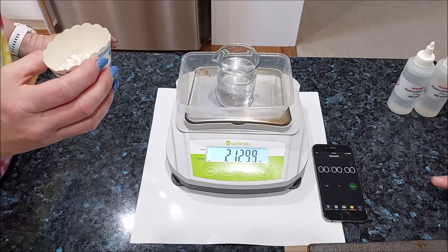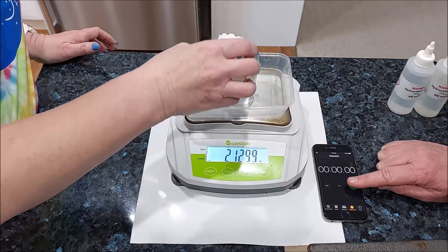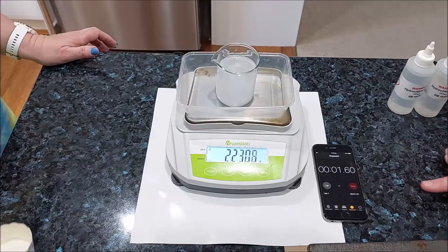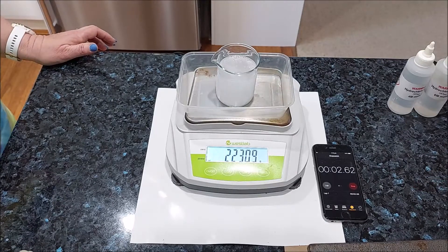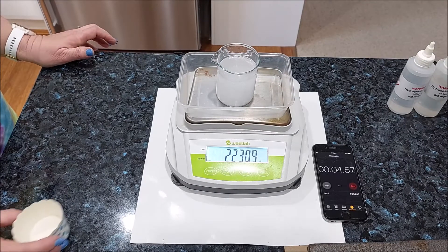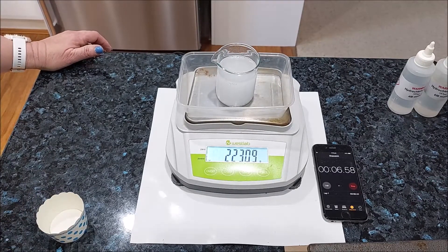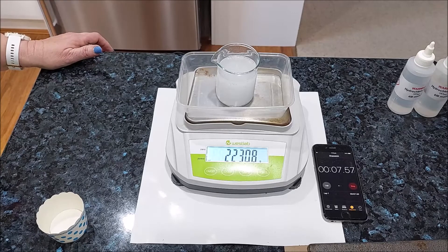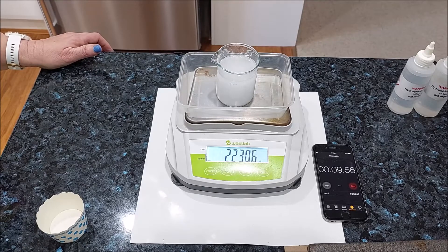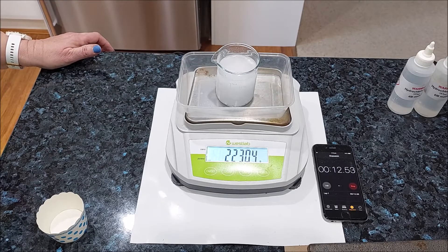Let's see. Ready, set, go. Not too bad. Remember, we're going to record the mass at the 1 minute and the 2 minute mark.